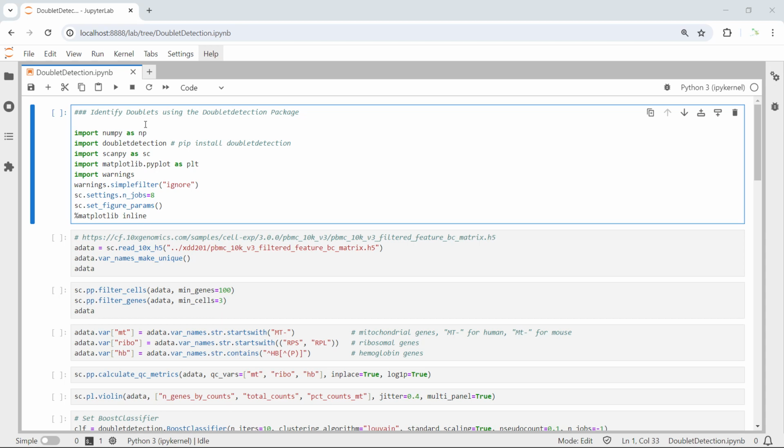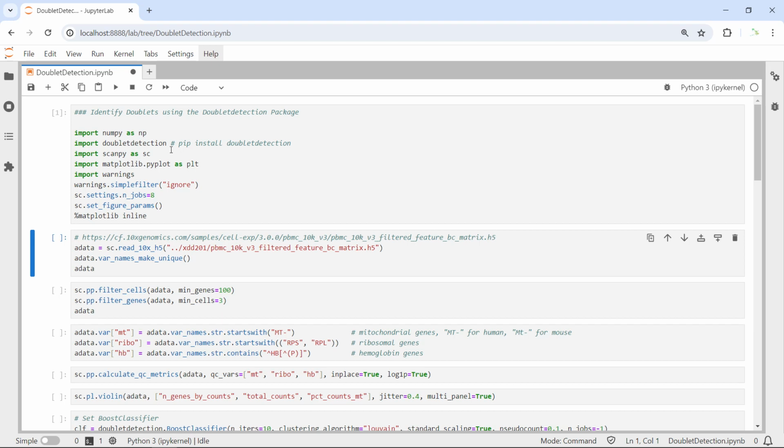So first, let's load all the packages for today's analysis. If you haven't installed the doublet detection package, you can use pip install doublet detection. Now we can load the demonstration data. I'm going to use the PBMC 10K cells dataset from 10x Genomics. You can download the data using this link if you want to use the same dataset to practice, or you can use your own dataset.